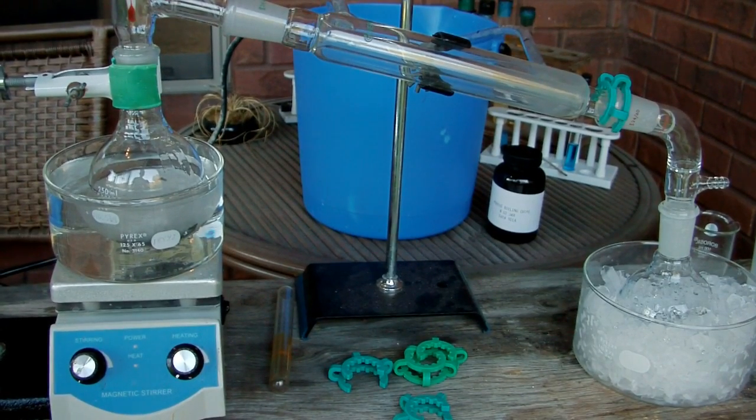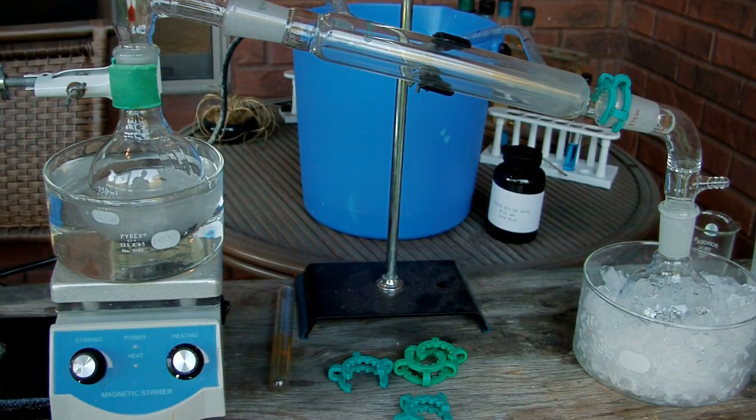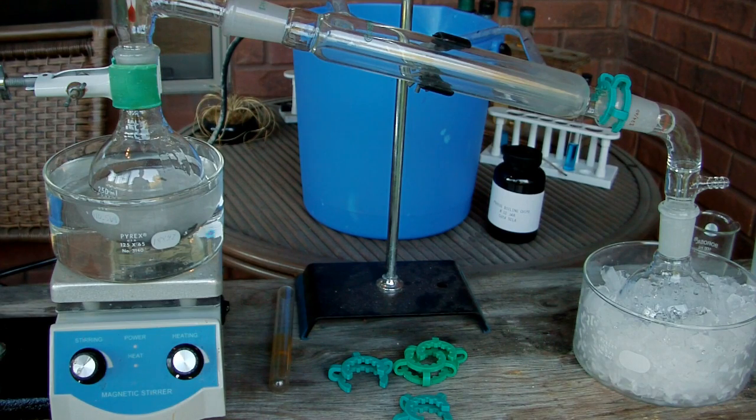Today's video is a continuation of my series on how to purify over-the-counter reagents. And this one is going to be on how to separate mixtures of liquids.